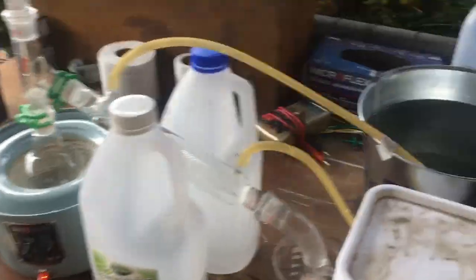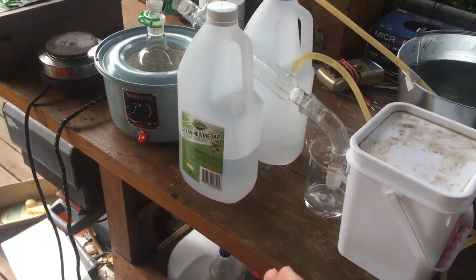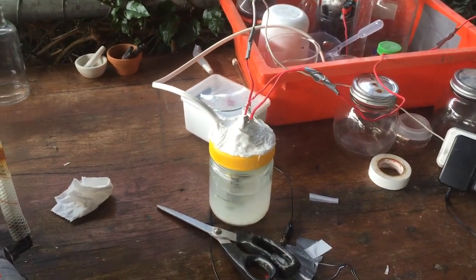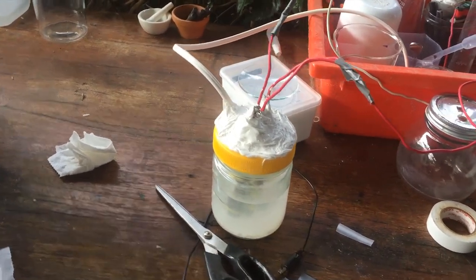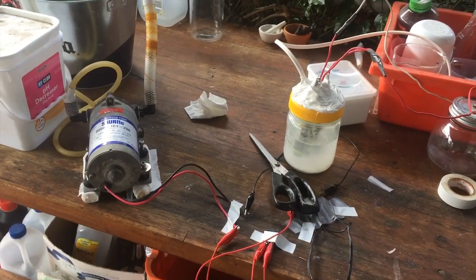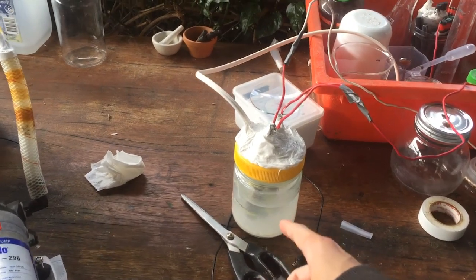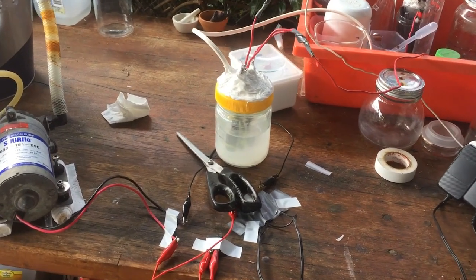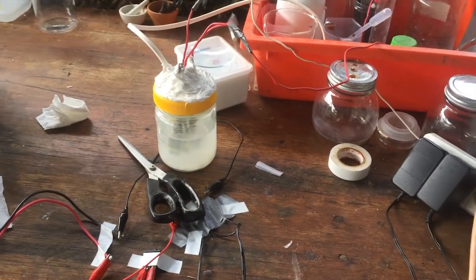So we're down to around 600 millilitres worth of concentrated deuterium in water. Once we've finished distilling, we should be able to reduce that down to 400 millilitres and then continue from there. What I've got here is just a solution of sodium carbonate, which should be able to be electrolyzed nice and slowly by my power supply. I think we'd been electrolyzing with this jar for a while with some sodium carbonate solution, and then I reached the point of saturation with that sodium carbonate.